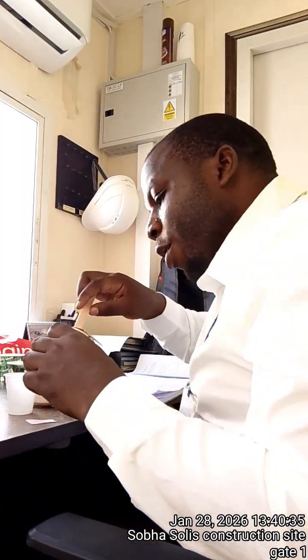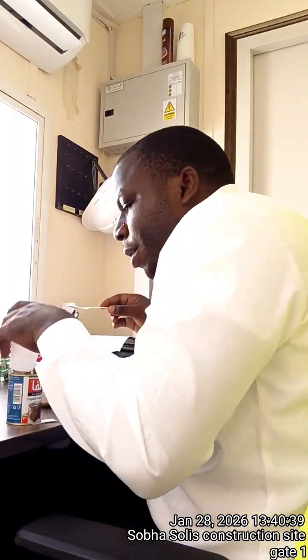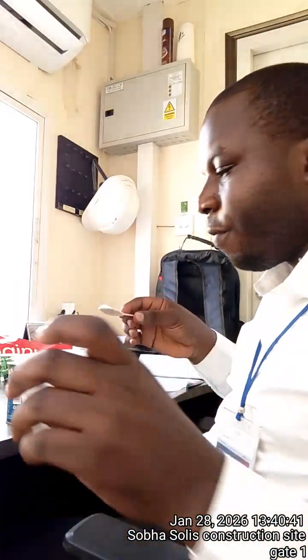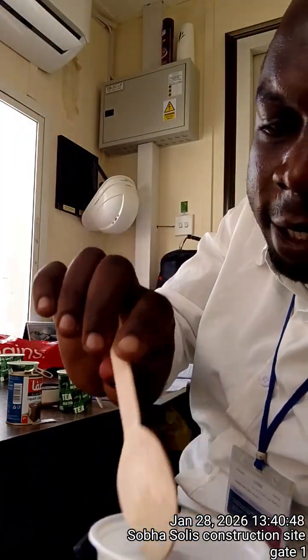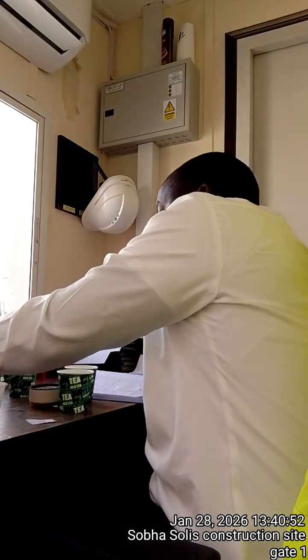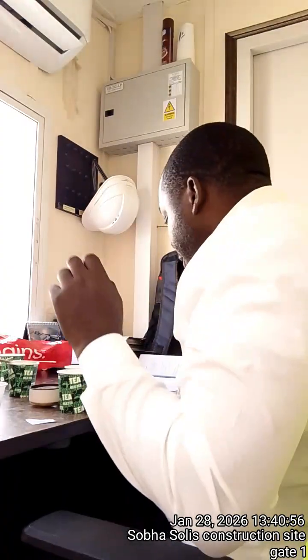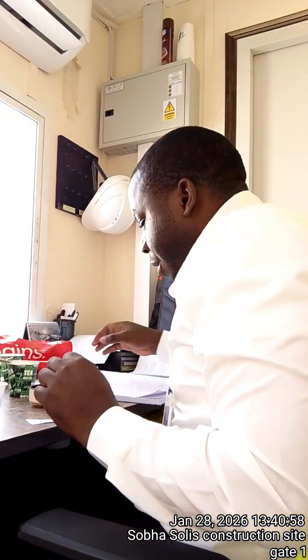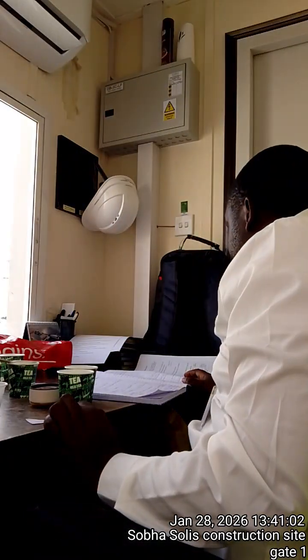I think you all can see this. Then also the same, please, as you add, you observe. Me, I've observed bubbles when I added this. Some 3, 4, 5 bubbles popped here. Then also here, I have the same amount, and I've also seen bubbles popping. After this, don't forget to cover your resources, keep them away.